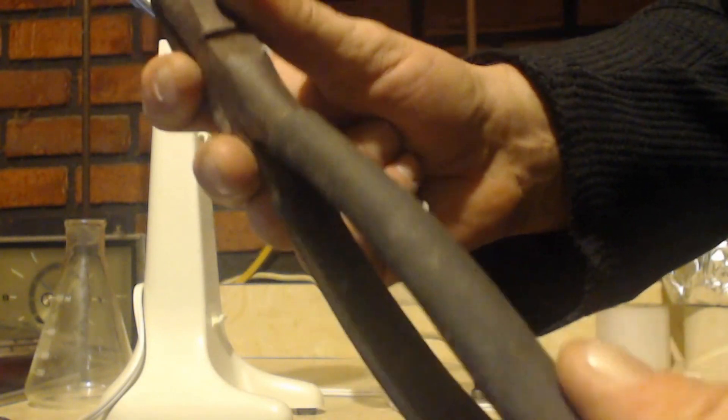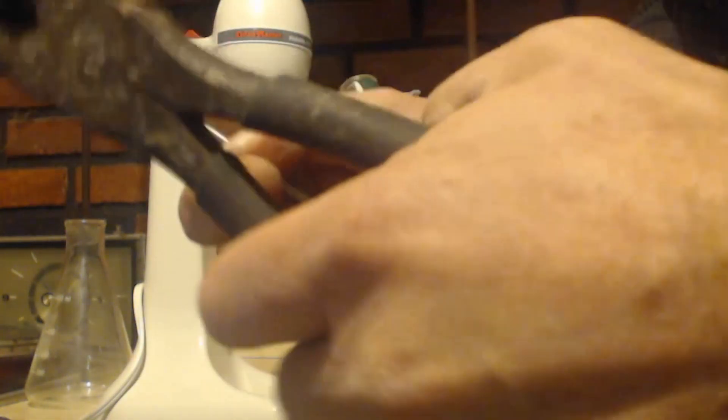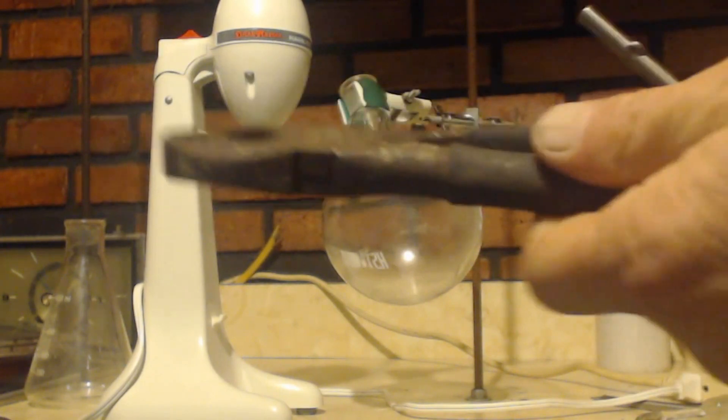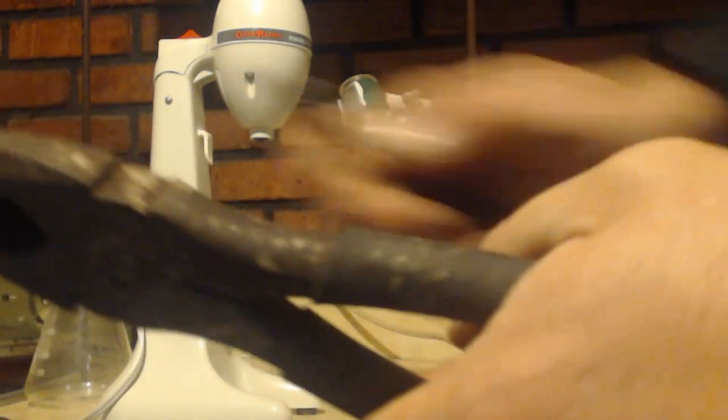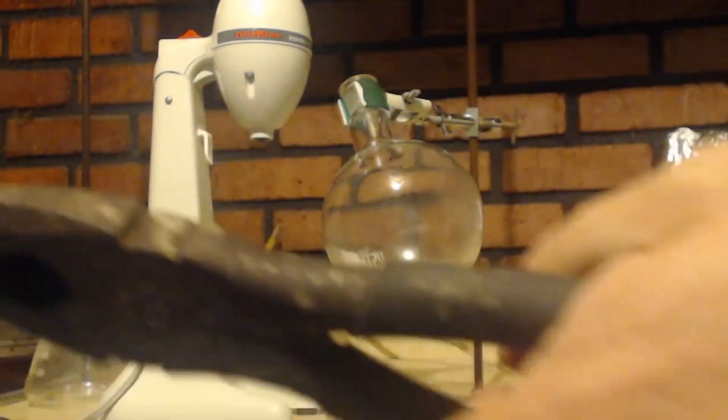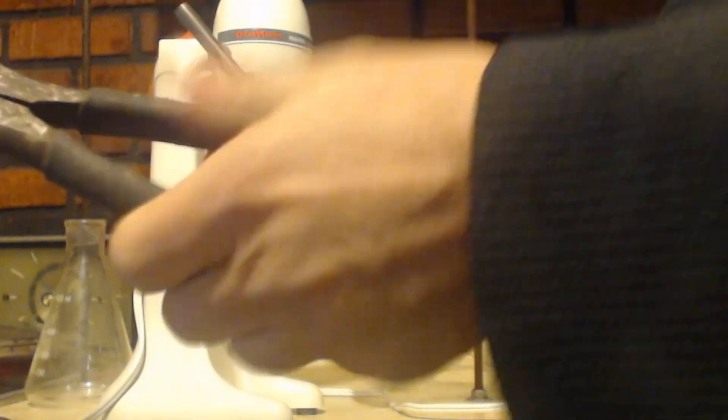On the handles it has this like, I don't know what that is, but they do that on a lot of tools. It helps insulate it in case you get electrocuted or something, and it probably helps if you're putting it on something hot, it thermally helps resist that heat.